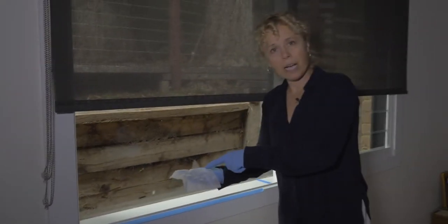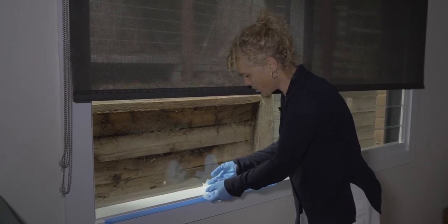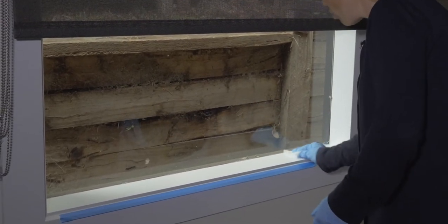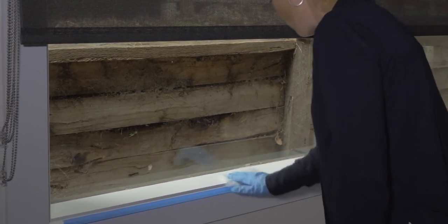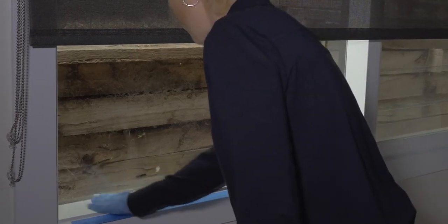Then the dirty part of the wipe, you're going to fold it in. So the dirty side goes in, fold it in half. And then I'm going to do another wipe, normally from top to down in an S motion. Top to down, covering that entire area as best I can.